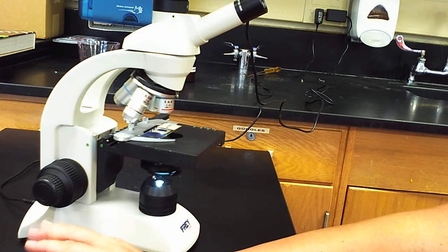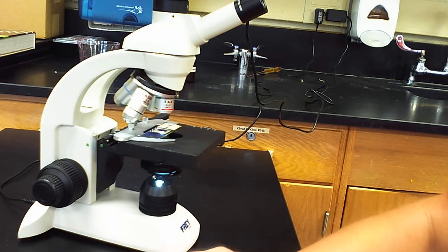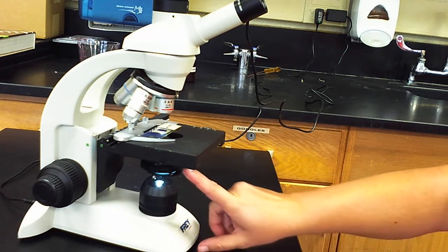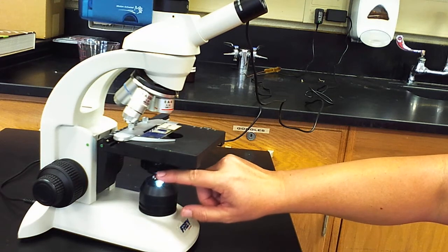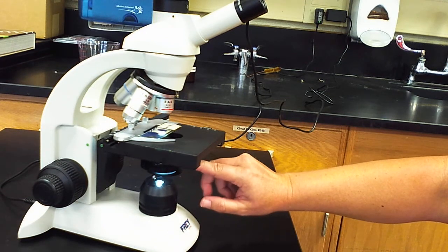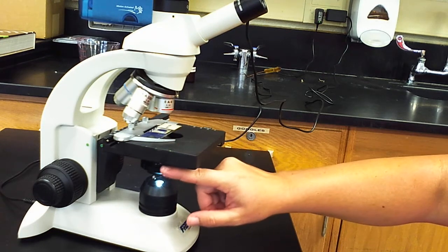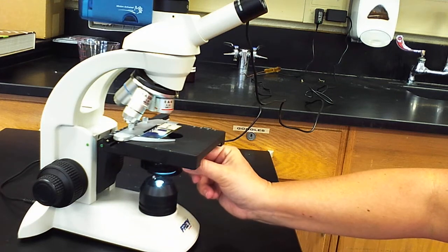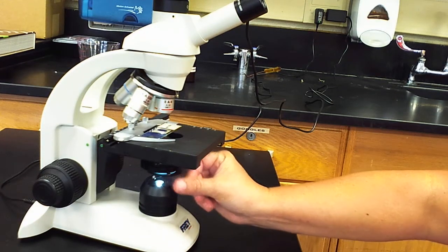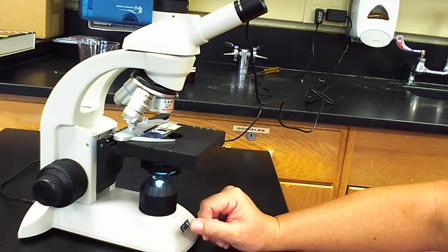There's a couple other features on this microscope that I know some of you have figured out and played around with, but the only other one I'm really going to mention that we might use in class is underneath. There is a little silver lever, if you can see it in the video. This is actually allowing different amounts of light to come through the stage of the microscope, and so that little lever is referred to as the iris diaphragm. Kind of like the iris in your eye will open and close and allow different amounts of light through. This is what we call the iris diaphragm of the microscope.